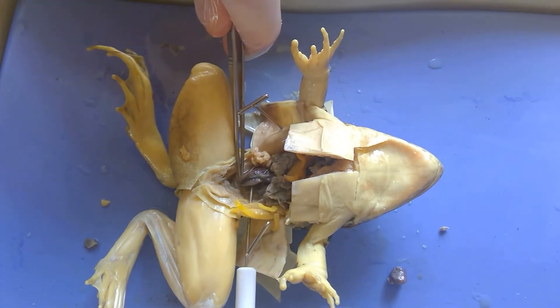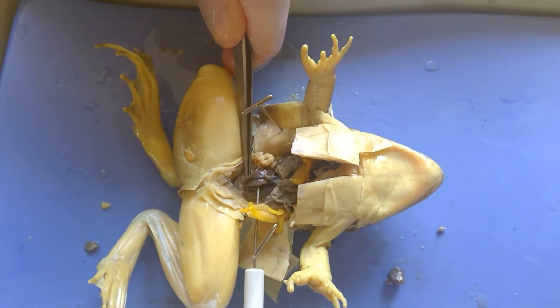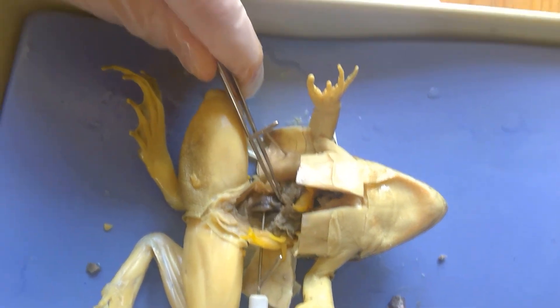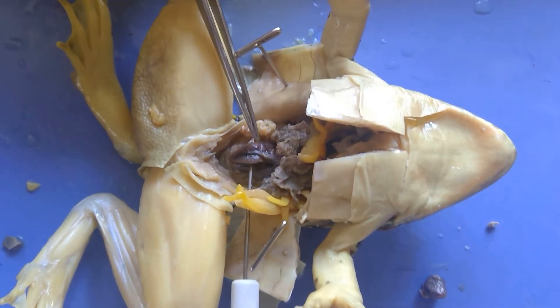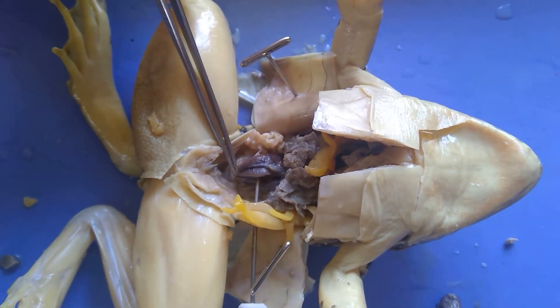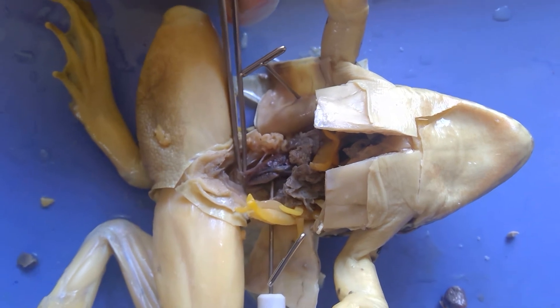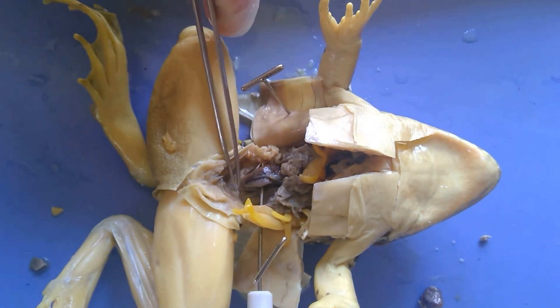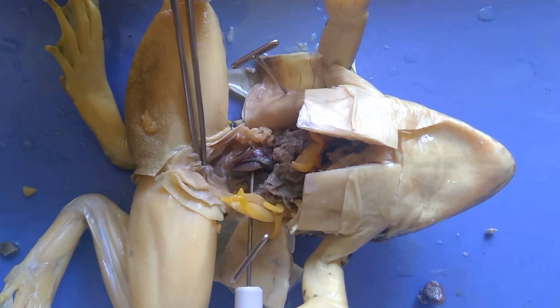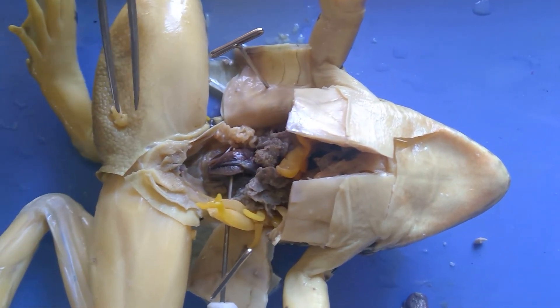The kidney is kind of a bacon color — brownish. The tube going down through here is the ureter, which drains the urine. Urine goes from the kidney to the ureter, then down into the bladder, and from the bladder it goes out through the cloaca.